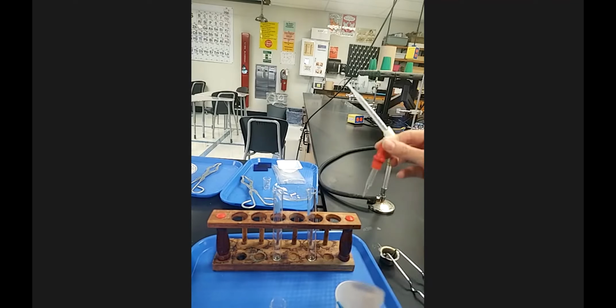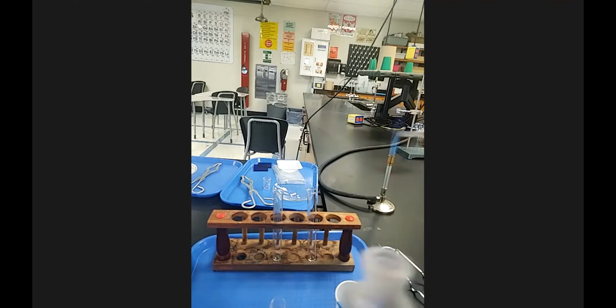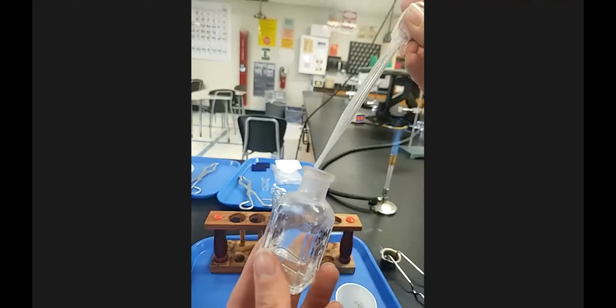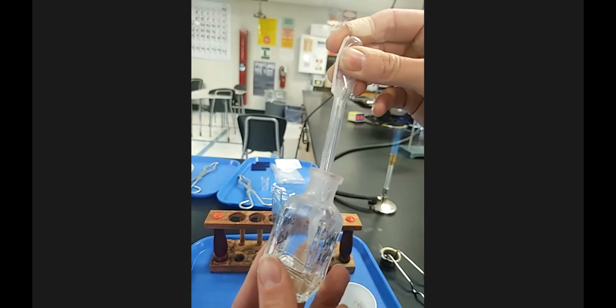All right, we're gonna set that one down. And this has hydrochloric acid residue, so I'm gonna set it down over to the side in the sink because I don't want to set that acid down somewhere where I'm working, because then if I put my hand down in it, well, remember, acid burns you from the outside in, base burns you from the inside out.